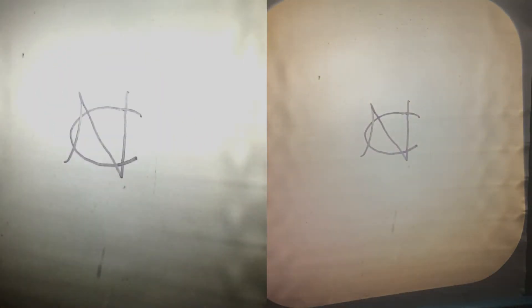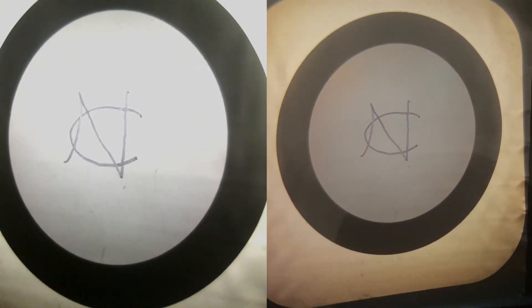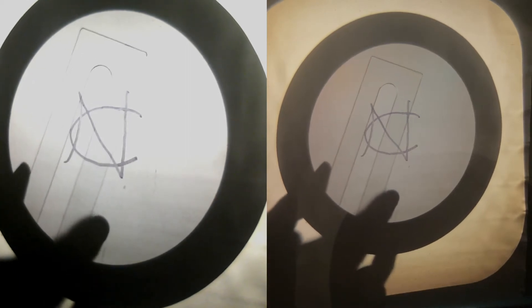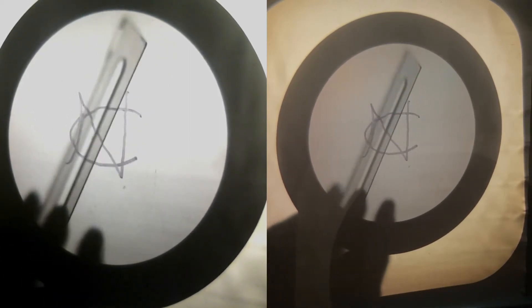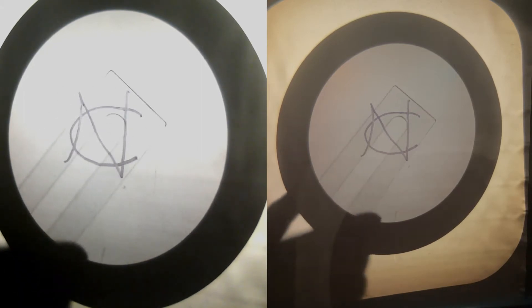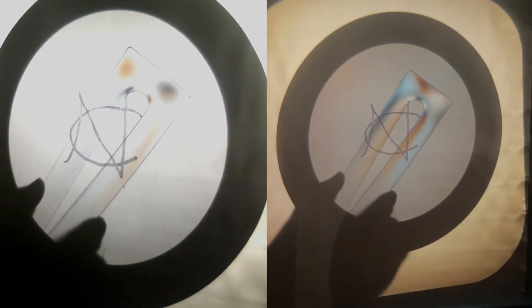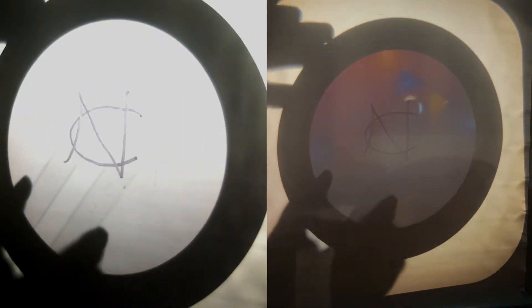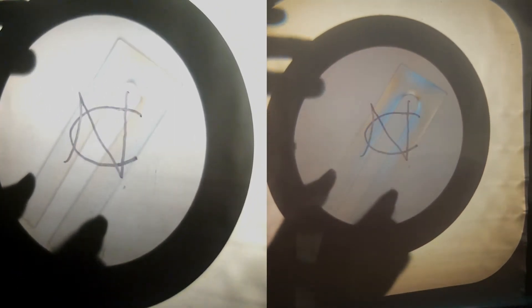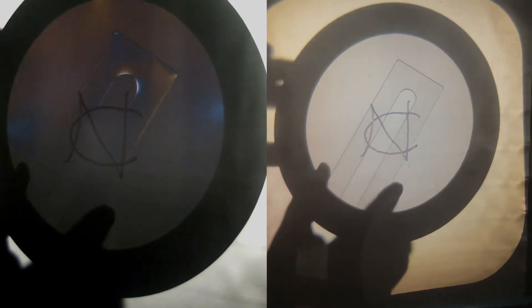Other things polarized light can do — what we'll look at now is how polarization can reveal molecular order. I have a clear piece of acrylic under very little stress or tension right now. But as I squeeze it, you'll see patterns emerge from the polarized light, because the polarized light is actually acting as a probe for molecular order. When it's under tension, light passes through because it rotates polarized light. When it's not under tension, it does not rotate the polarized light.